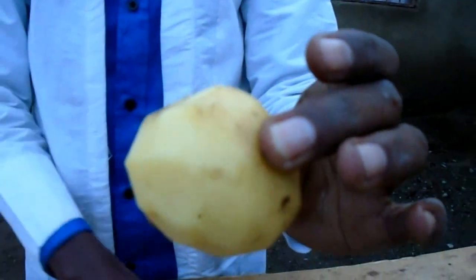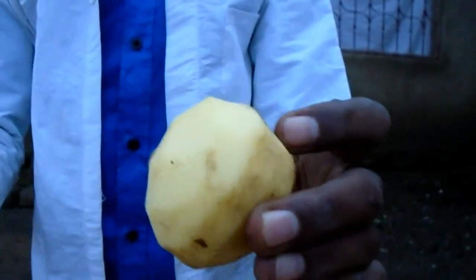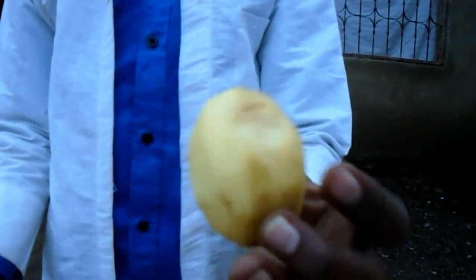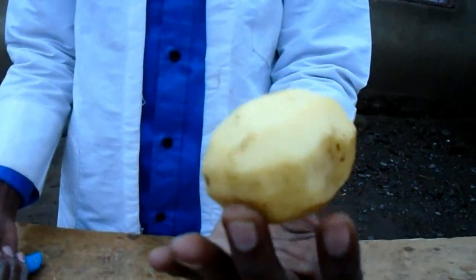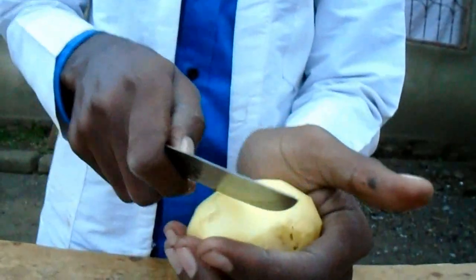The second procedure is to use this sharp instrument — this knife — so that I can cut a small piece of this Irish potato, so that I can put my solute concentration there and see what will happen when we add a solute concentration at the cut region of this Irish potato. So I'm just going to cut as follows — I'm just cutting a small piece here, a small cut like this.